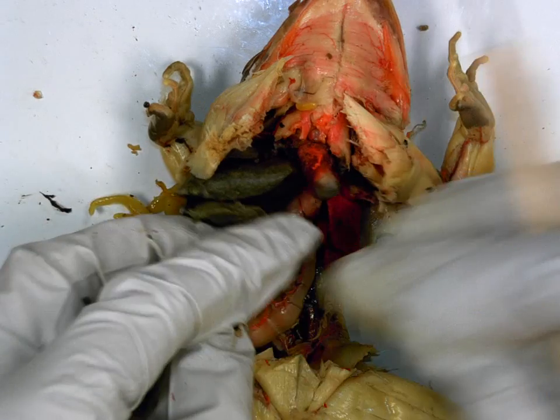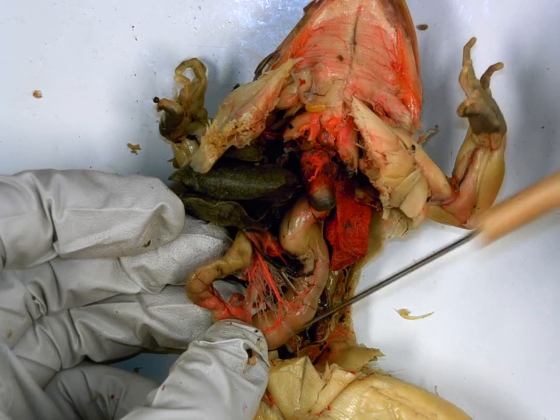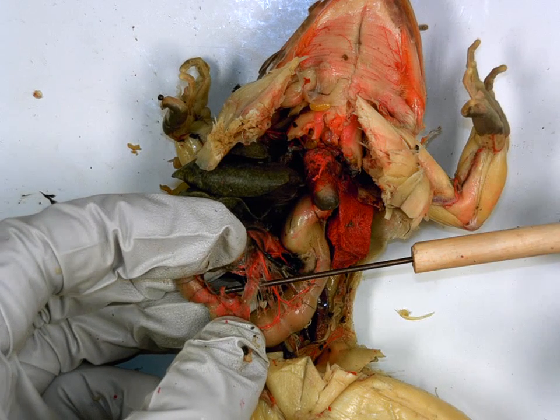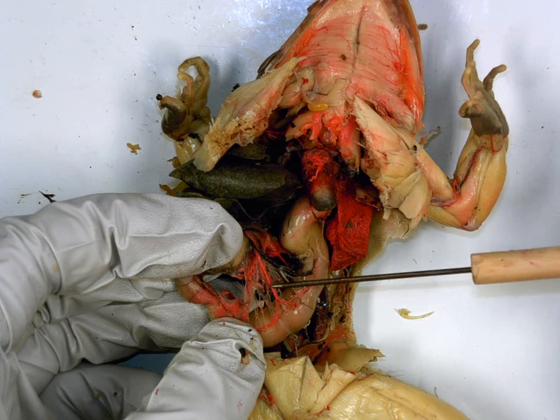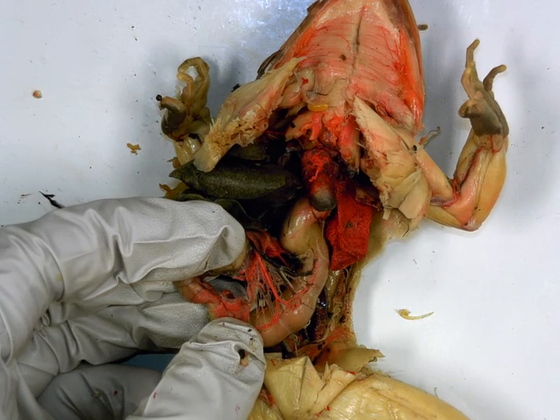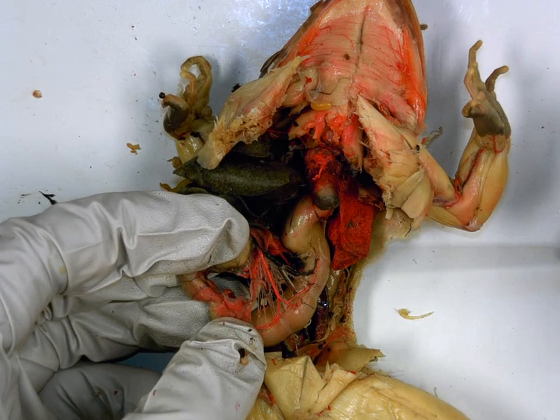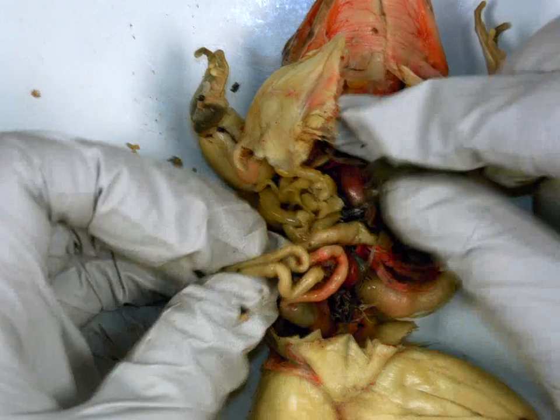Now, the one thing you can cross out that I will not be able to test you on is this thin membrane in between the J shape of the stomach, which is the pancreas. But it is so thin, it's impossible to pin and test because it's just this thin yellowy material in between the mesenteries. So you can cross that out on your lab because I can't pin it, which means I can't test it.